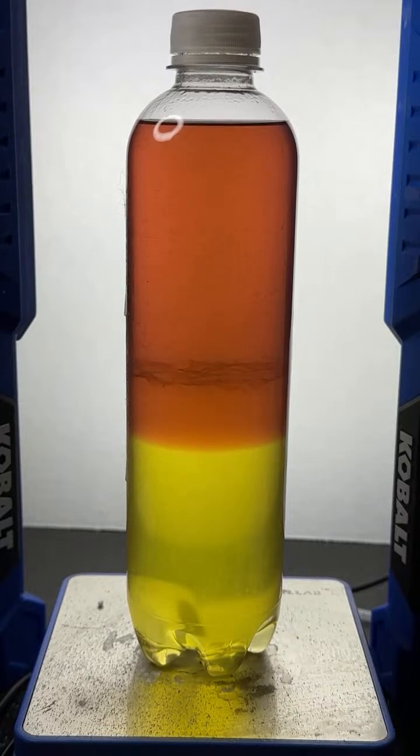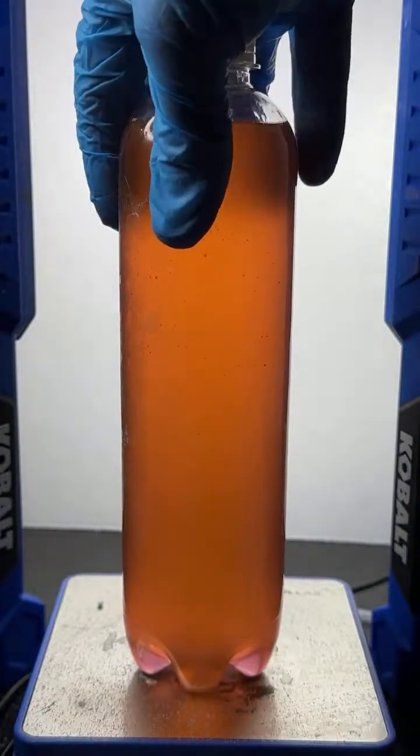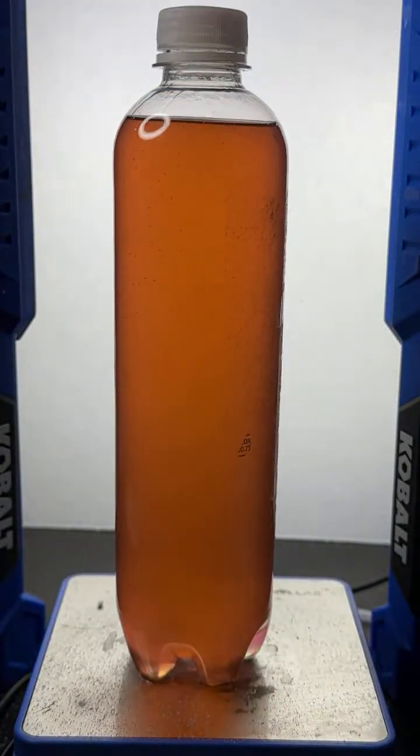I agree, Shrey. It is very interesting to see. So, when you shake up a bottle of salad dressing that has oil and vinegar, which is basically oil and water, you're making an emulsion. It's just that emulsion separates really quickly. This one takes quite a bit, as you can see. And I like that because it gives you some time to process what's happening.